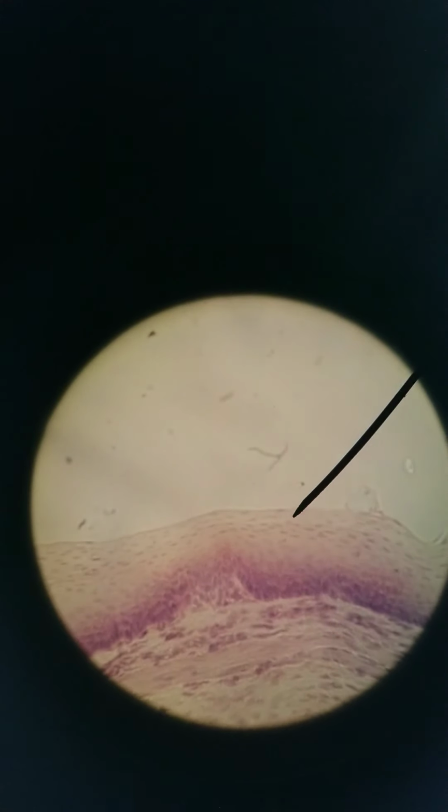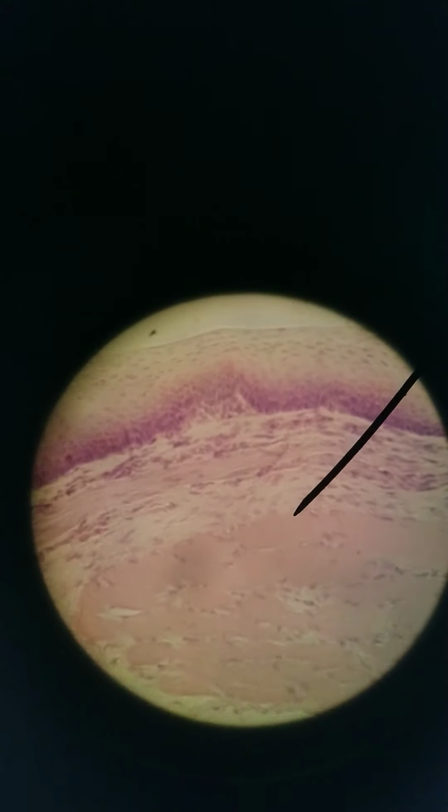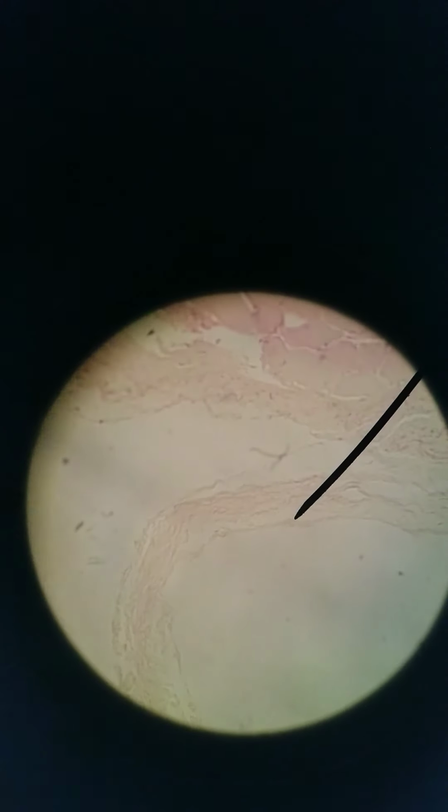And here you can see non-keratinized stratified squamous epithelium, lamina propria right here, areolar connective tissue, muscularis mucosa right here, submucosa, more areolar connective tissue, and then from here down, lots and lots of muscle of the muscularis externa, and then there's some fat and adventitia. Adventitia's out here. There's that dense irregular.